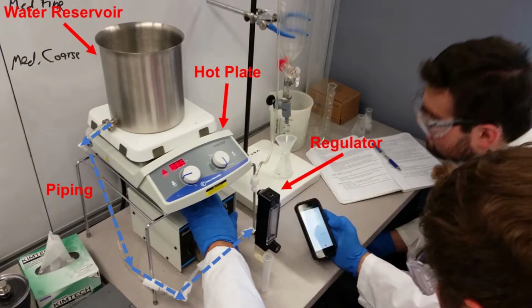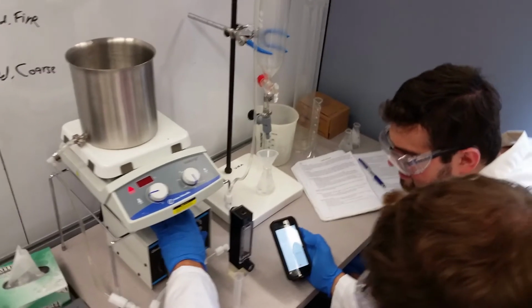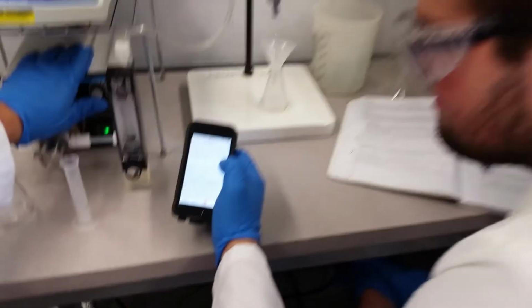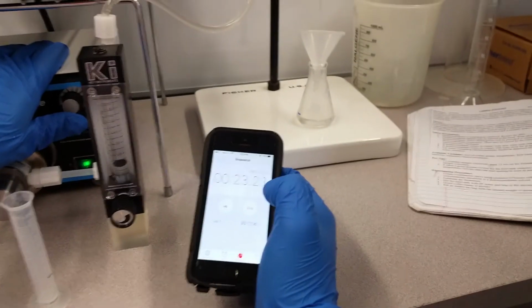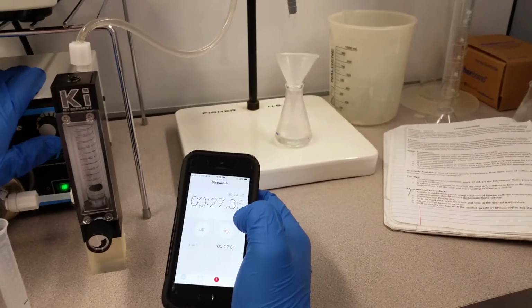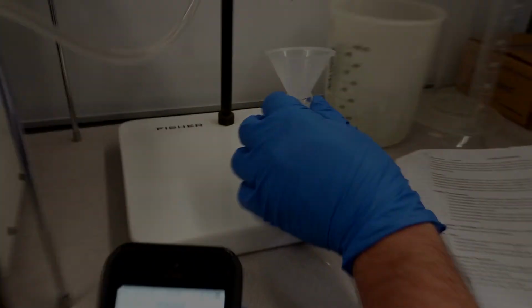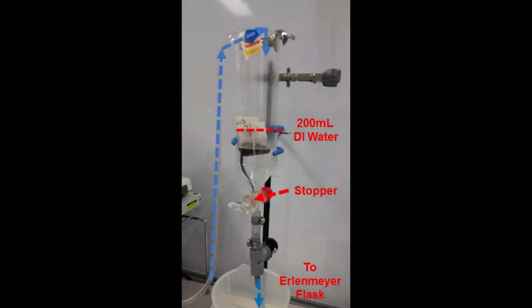This wasn't given as a volumetric flow, but as a numeric value, and we set our numeric value to 10, where it pumped it up another little plastic line into our reactor, which was a piece of glassware with a stopper, which allowed us to control the outlet flow, and where we were able to control the volume of DI water that was held in our reactor. And it was collected at the bottom into 15 milliliter samples in Erlenmeyer flasks.